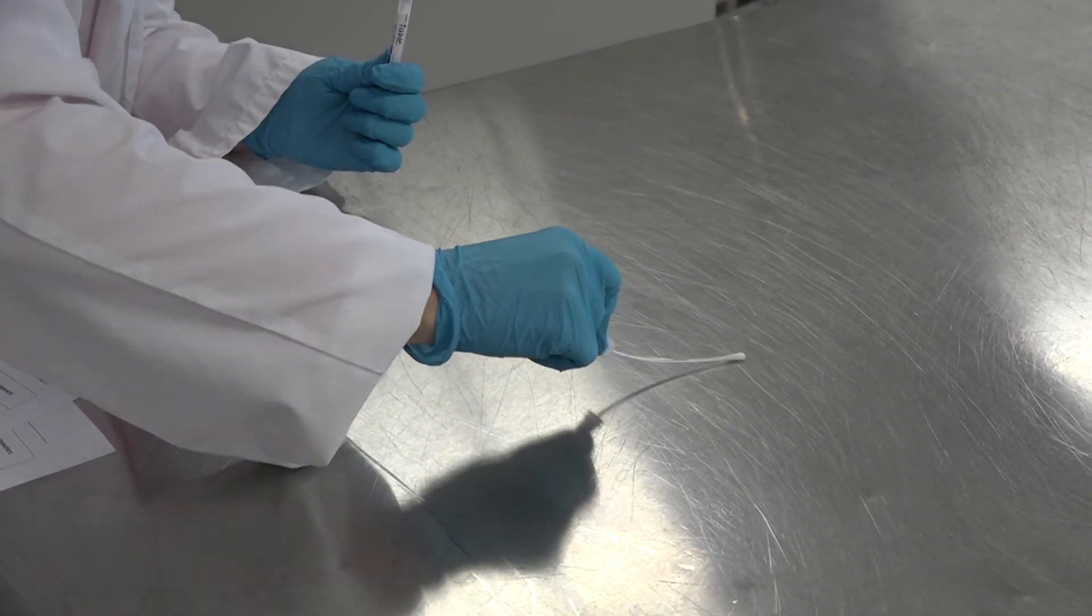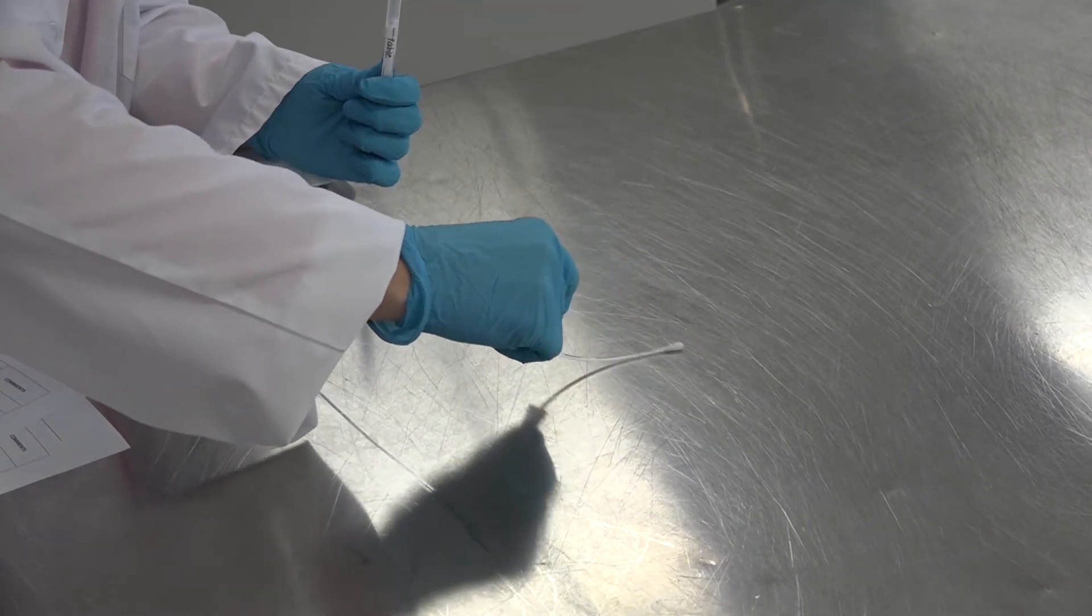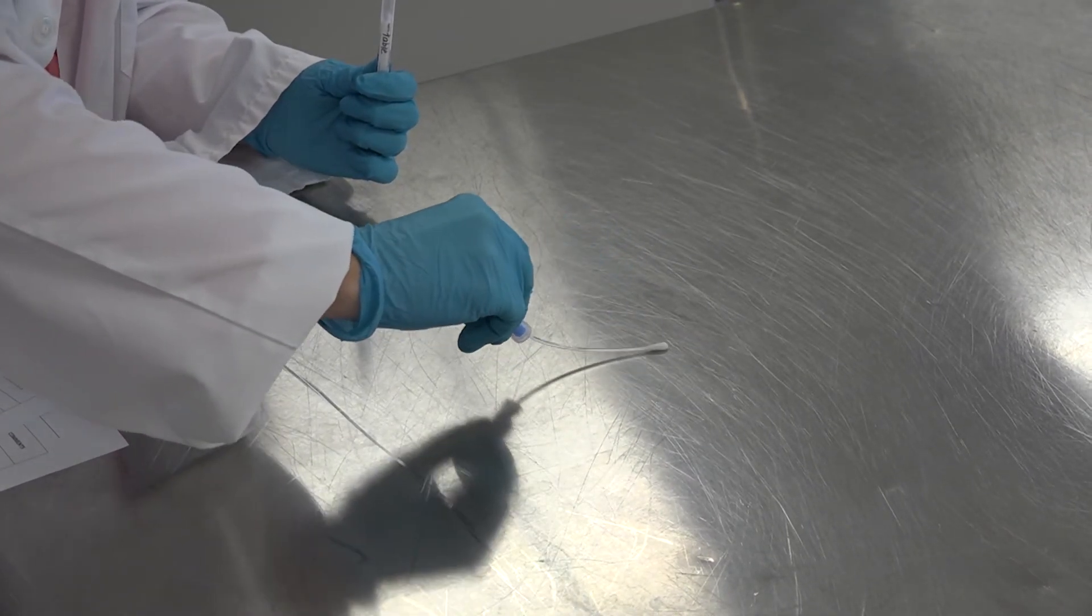Step number four, use a criss-cross pattern ensuring an even coverage.